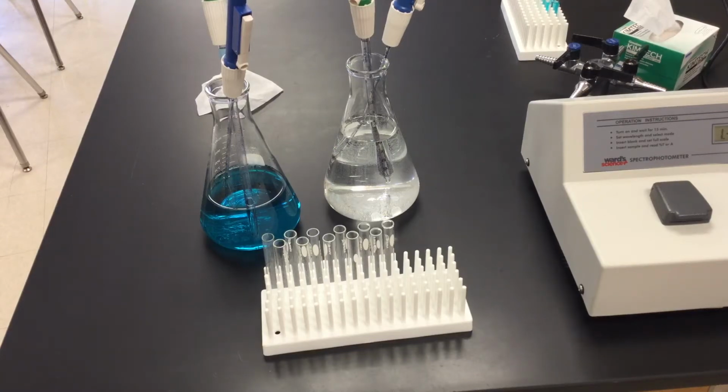Part 3 and final part of our spectrophotometry lab. So with the first part, we created that absorption spectrum. What colors of the visible light spectrum do we see at each particular wavelength that you guys created there? The second part, we worked with 5 milliliters of water as well as 5 milliliters of copper sulfate.